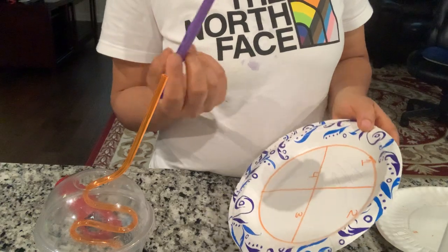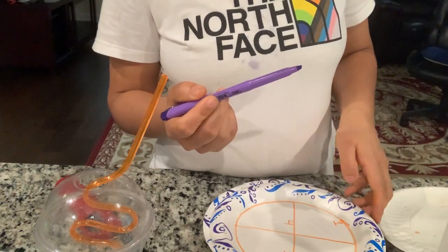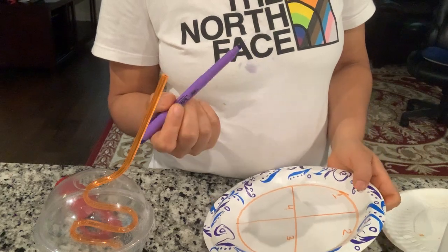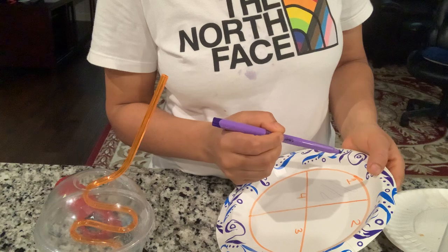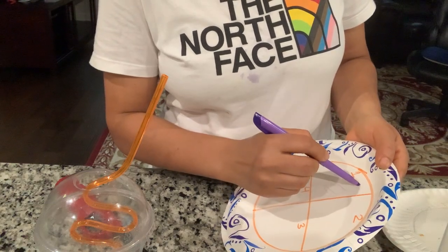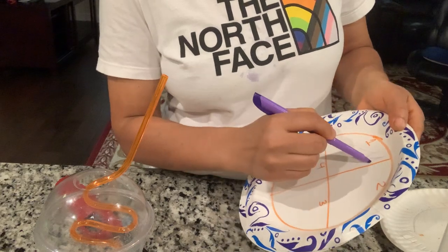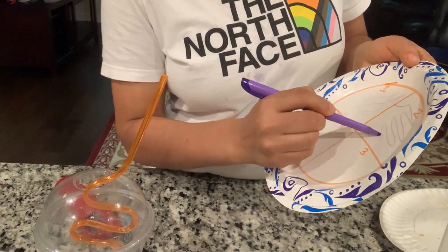Let it cool down. I'm going to draw quadrant two — for that I need to use a little sample from quadrant one. So I just transfer some sample from quadrant one to two, and this is my quadrant two.